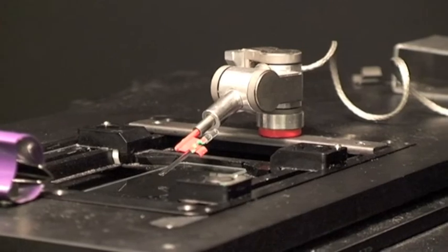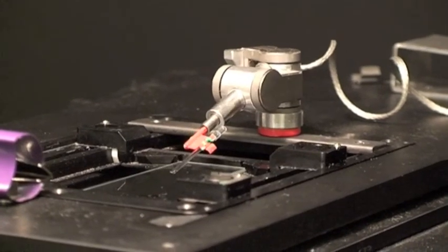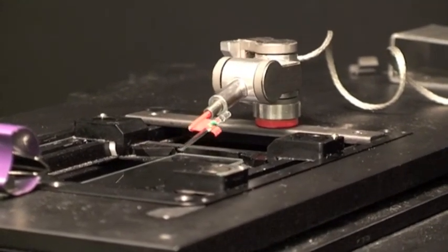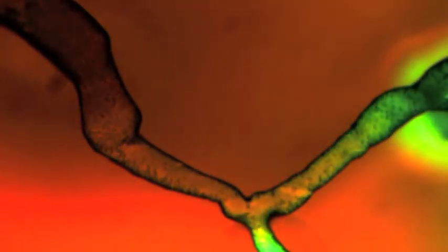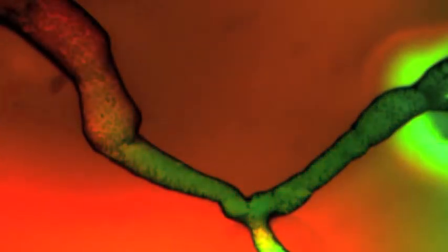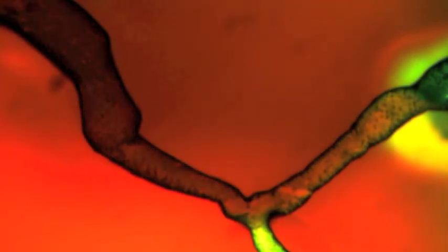We use a micro-manipulator to inject into the tubes. Here we're using it to flow in differently colored dyes into the two inputs of a Y-junction.